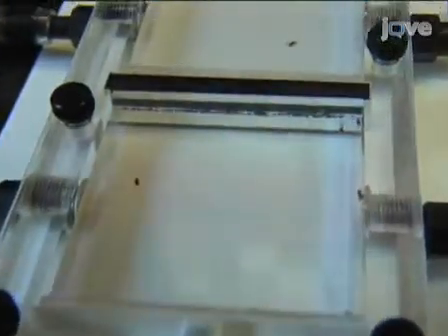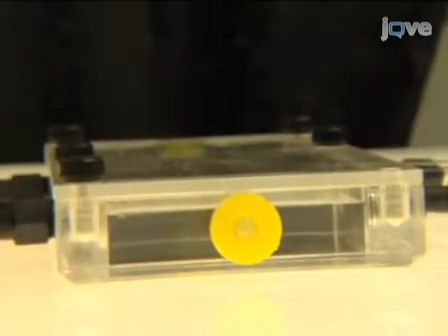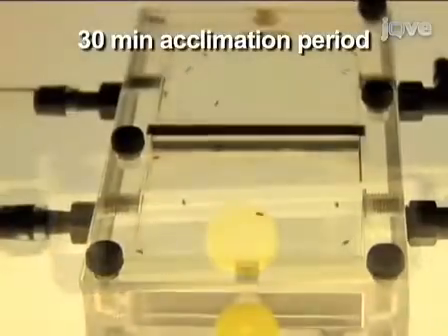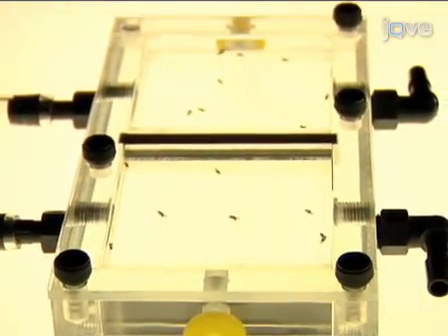Once the flies are properly loaded, place the chamber on top of a light box. Turn off the other lights in the environment room and let the flies acclimate in the chamber for 30 minutes. After the 30-minute acclimation period, proceed with the locomotor assay.